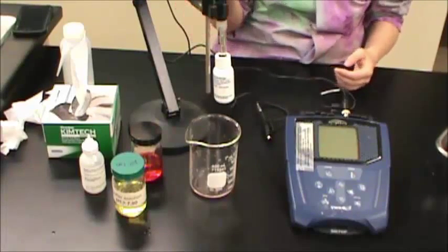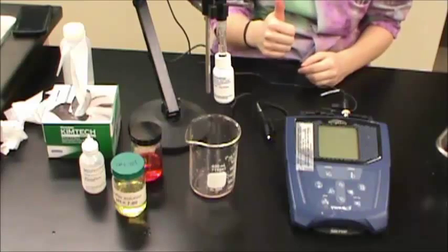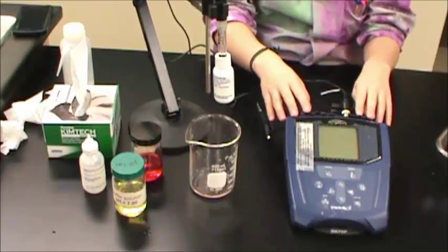This is the instructional video for a two-point calibration of a Symphony pH meter. Before starting your calibration, make sure you have the following items.